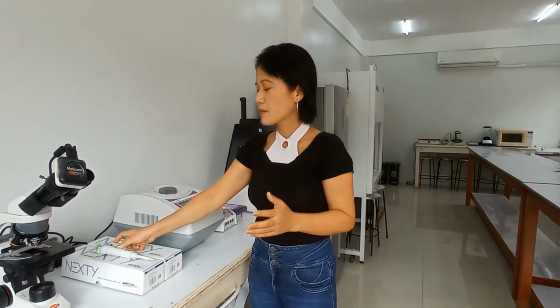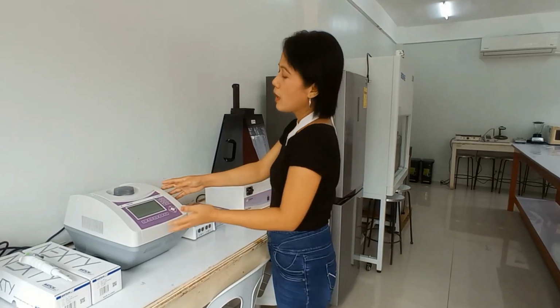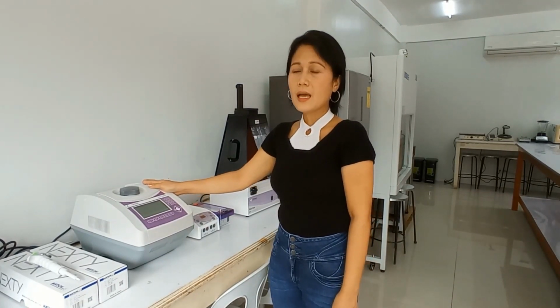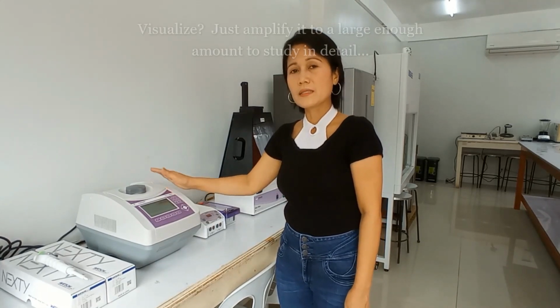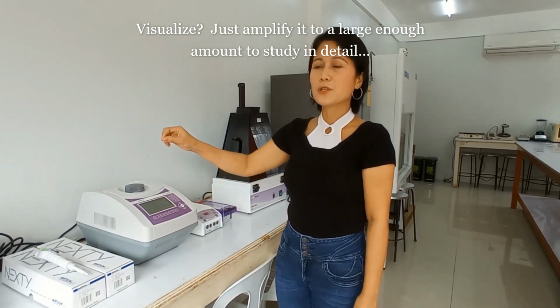DNA materials. And speaking of DNA materials, we have in here the PCR, or the polymerase chain reaction. This one is able to make millions to billions of copies of DNA material so that researchers or scientists are able to visualize it. So when I say visualize, how do we do that? So first, we have to load the amplified DNA into gel wells.